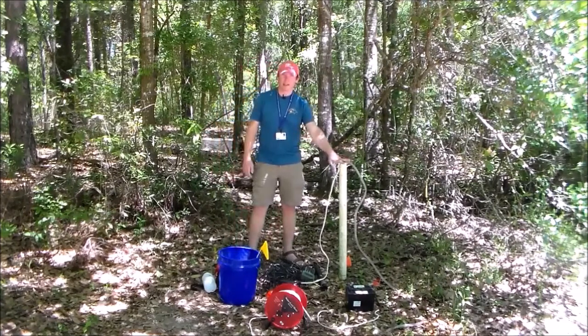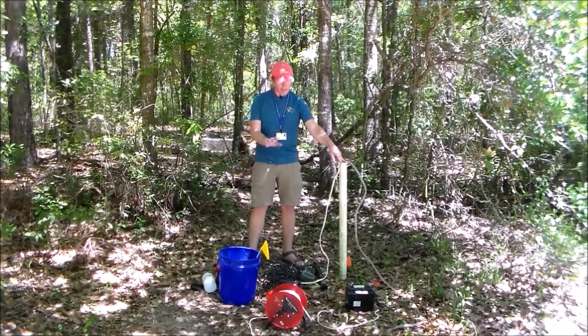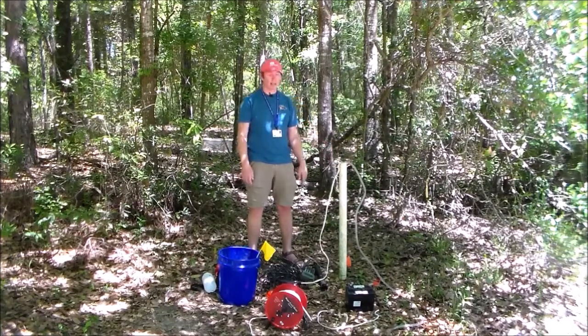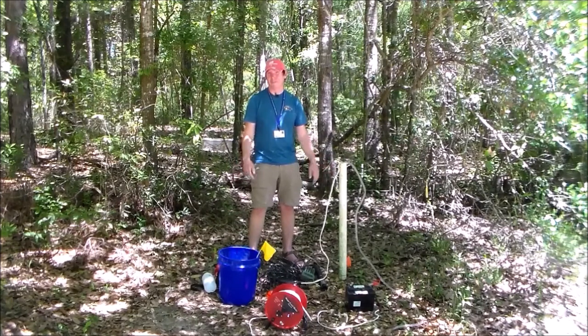Another thing that may happen in a well is if you let it stay stagnant for some time, there's a high probability that you might get some sort of bacteria growing around your screen, and we call that a well skin. And the way to get rid of a well skin is just to pump your well. The problem is you may see that kind of orangish color come out towards the surface. It's almost like turning on a pipe for a bathtub. If you don't use it very often, it can come out looking kind of gross. Well, in the case of the well, it's going to have that iron precipitate. It's also going to, a lot of times, have some bacteria, this kind of film on the outside.